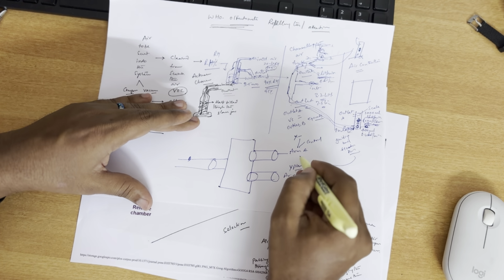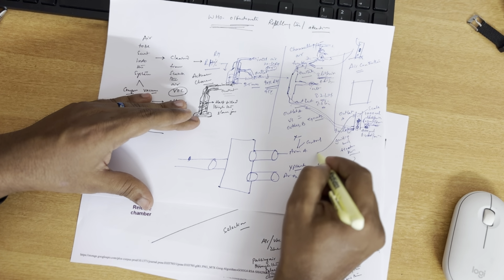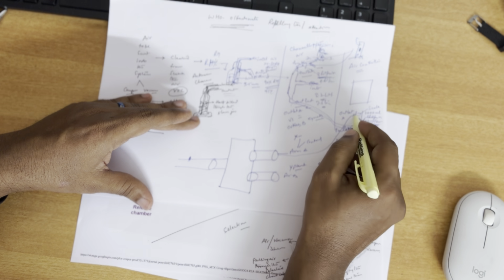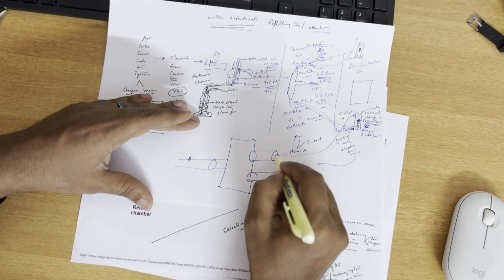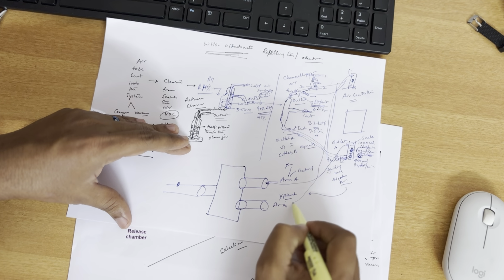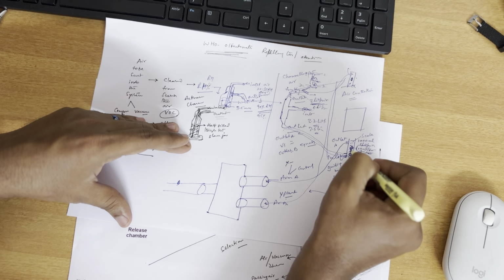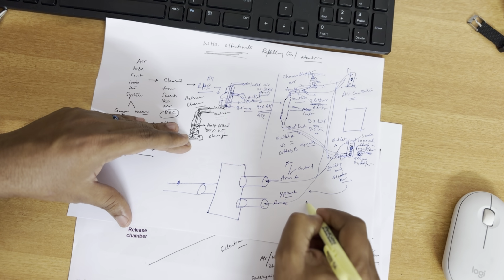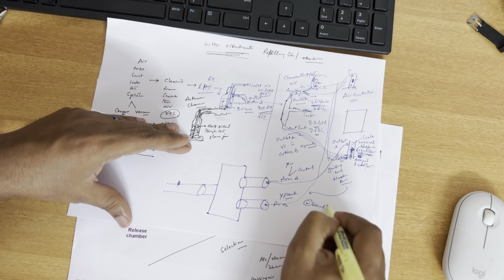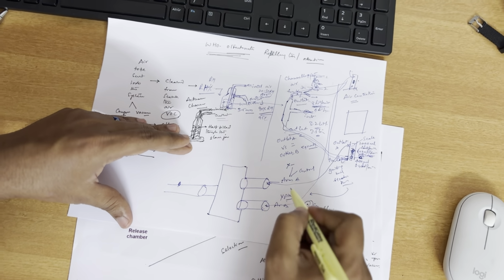So now the controlled air from here, this is the outlet. This outlet will be connected to the inlet of chamber A, arm A, and then from here you are going to connect into arm B. So the air that is regulated here at the rate of 600 ml per minute is sent to arm A as well as arm B.